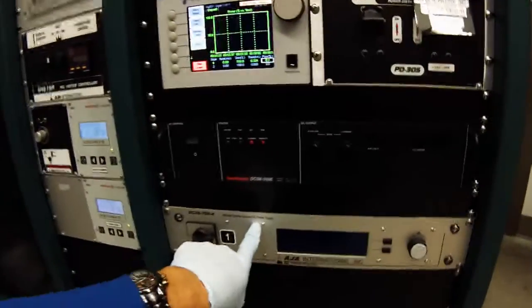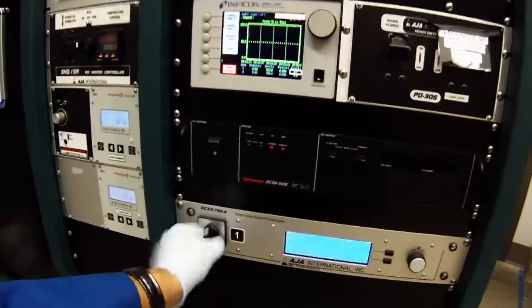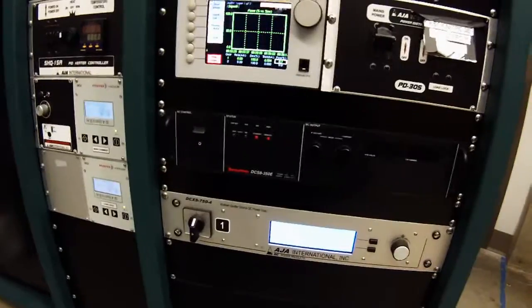Our system only does DC for now, so this is a DC power supply. To turn it on, all you have to do is flip the switch. Now we go to the fourth thing to check, which is the gas.